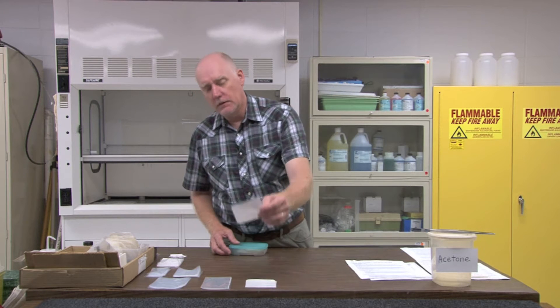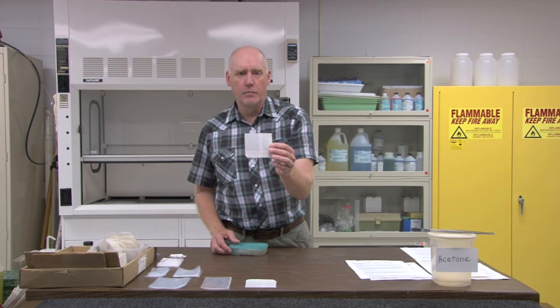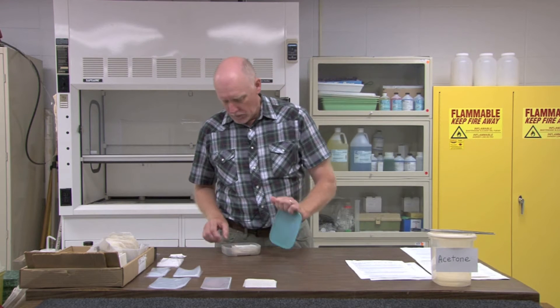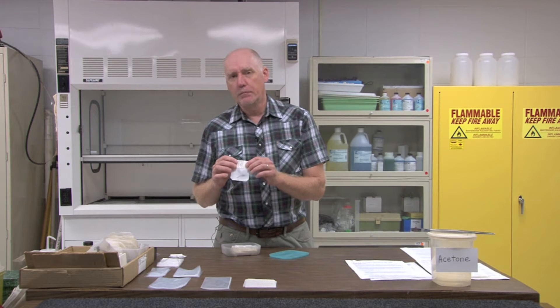So at this point you're coming into your home after a collecting trip where you've collected a dragonfly or a damselfly. I use little Tupperware or Rubbermaid type containers in order to hold glassine type envelopes, which can be purchased from BioQuip Products in California, to place the live dragonflies after they've been collected. Whenever you collect a specimen it is extremely important that you affix a date location label to it immediately. Don't try to remember later where you collected a specimen — clip the date location label right onto the glassine envelope in the field that contains the specimen.